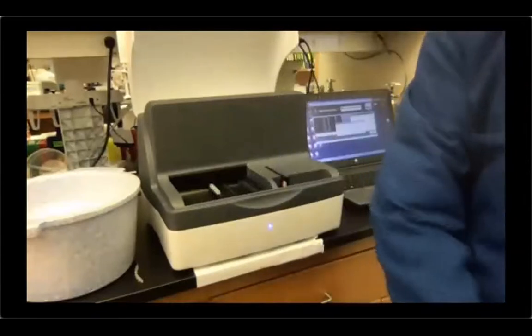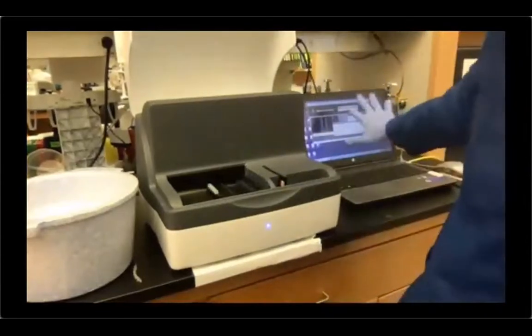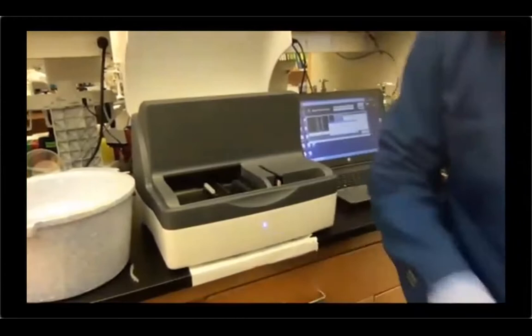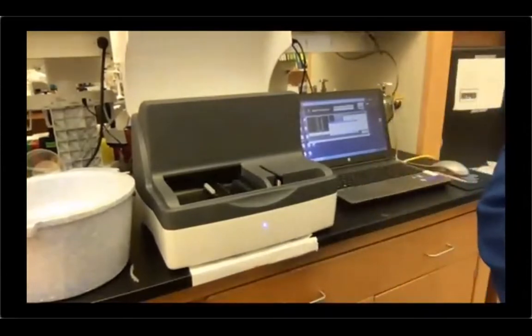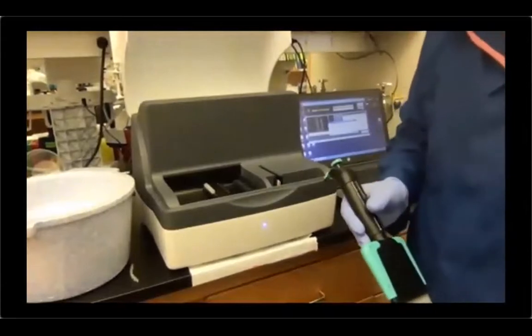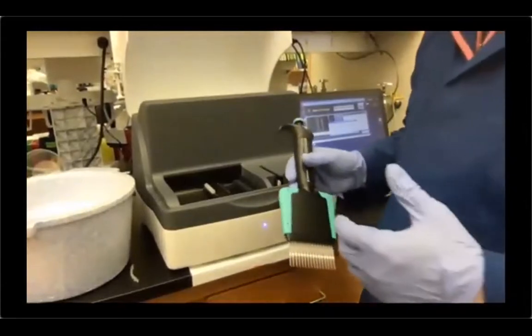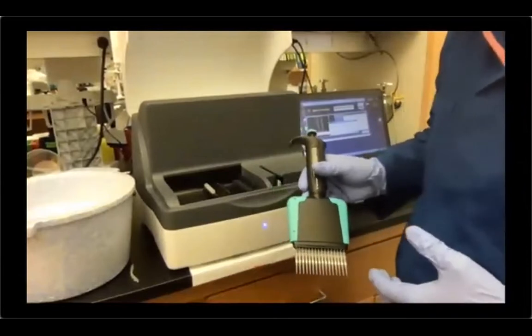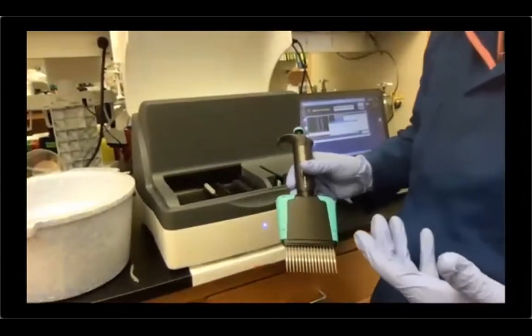And then we're gonna have some questions that the software is asking us. We're gonna see that in a moment. For the tips, we are running only 6 samples. However, I usually don't care too much on how many samples I'm running, unless I'm running low on tips.